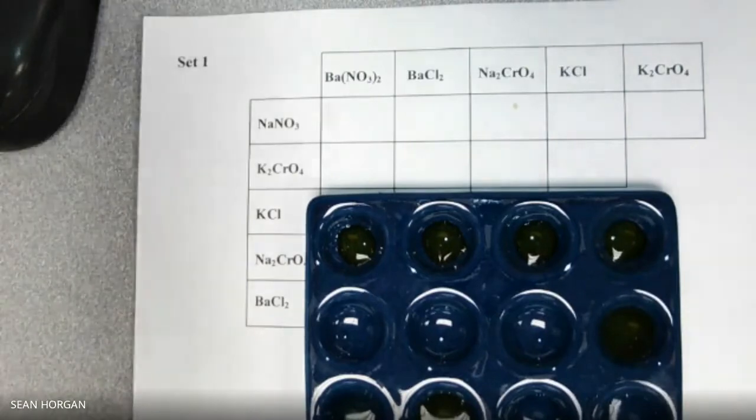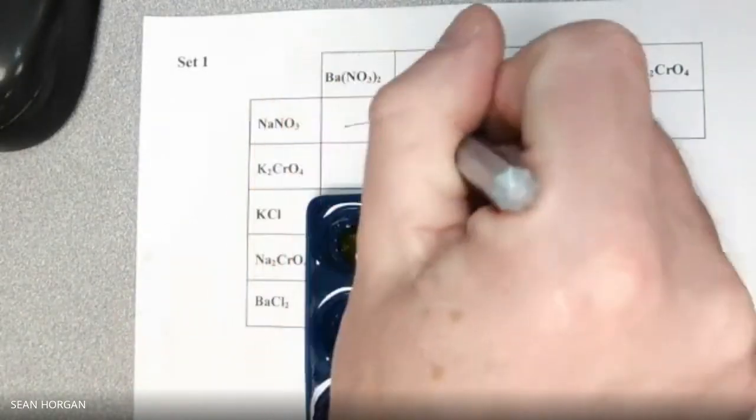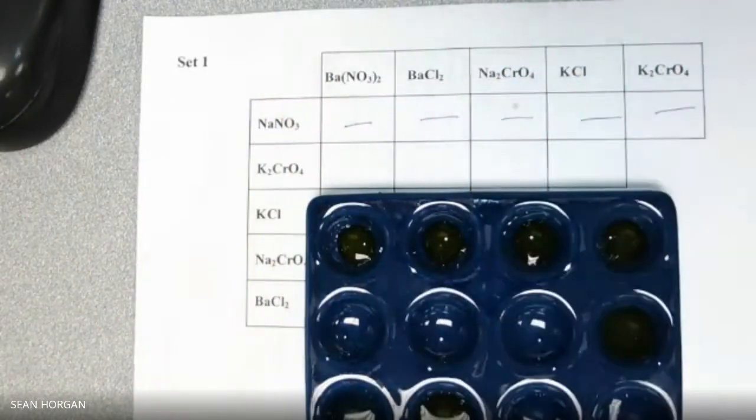Okay, and actually in the top one, we're just going to go negative, negative, negative, negative, negative. Nothing happened. Again. Okay, we'll live with it, and we'll change it if we need to at the end. All right, so that's those. So we'll put them in.